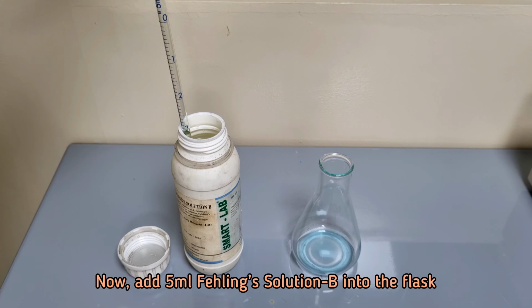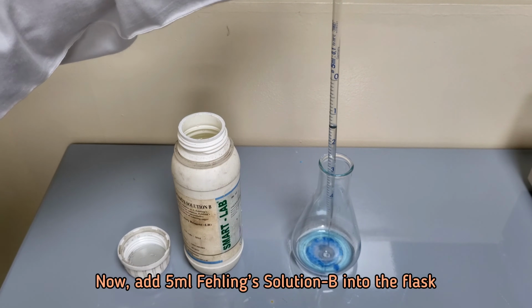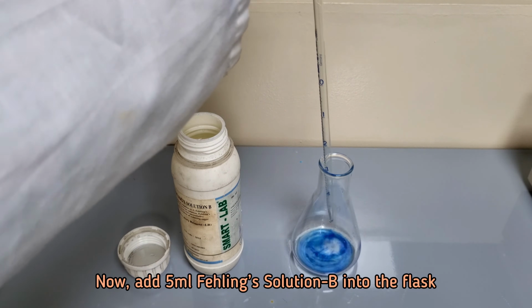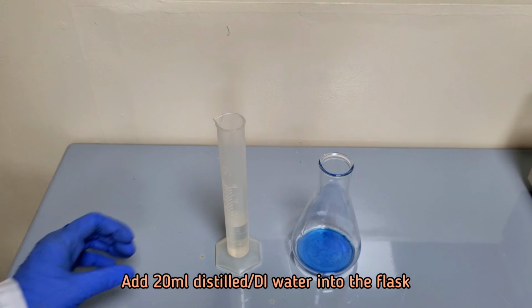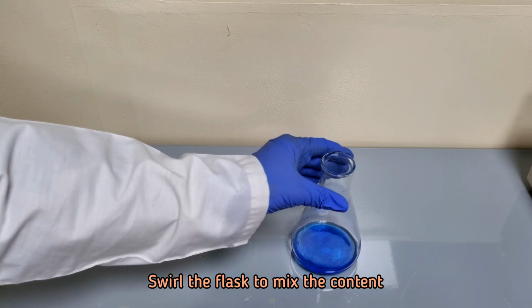Now take 5 ml Fehling solution B into the flask. Add 20 ml distilled water and swirl the flask to mix the content.